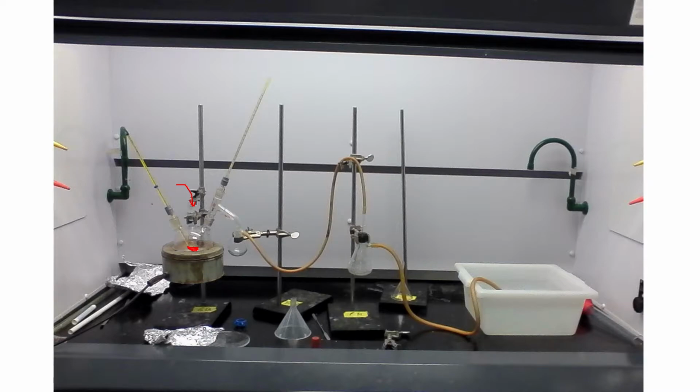You can see in the leftmost neck, we have our mercury thermometer. This is the one that can go up to 400 degrees Celsius. And we want it to go high so that we can check how hot the inside of the flask is. The second thermometer is here to show the temperature at the neck, I guess not the flask, but the joint, so that we can make sure this area is cool, so that once things begin to boil and the gases go up, they eventually undergo condensation and become a liquid up here in this neck.